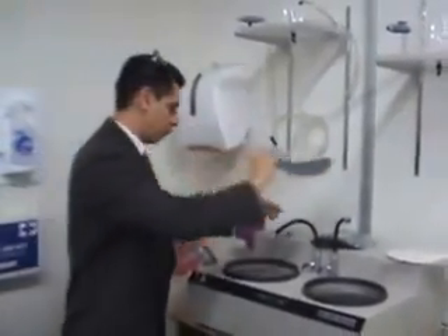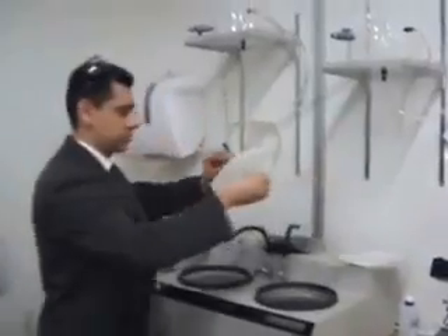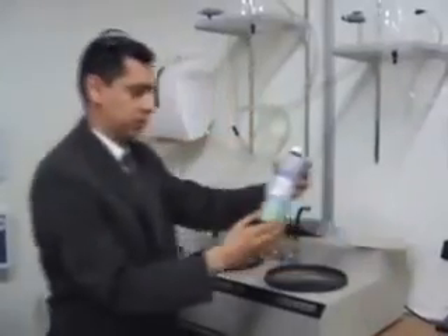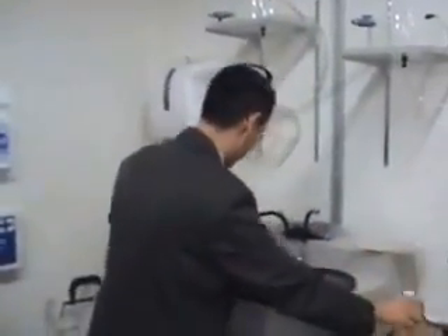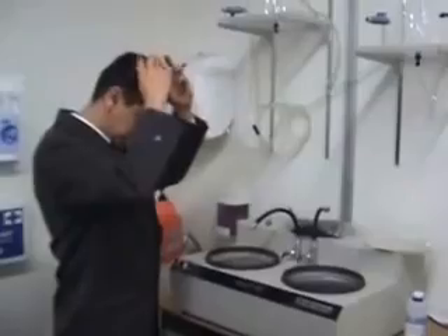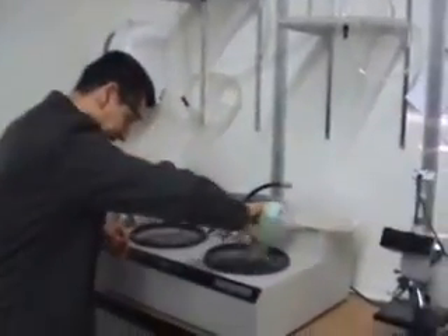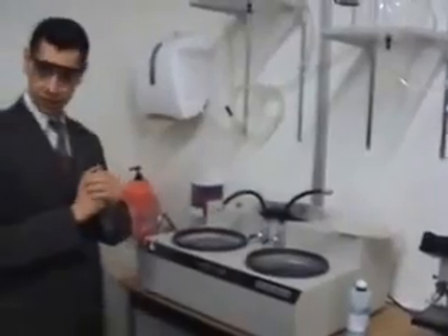After this, hopefully you have removed all the scratches. The next step will be polishing the surface. For that, you will be using this pad and then adding some of this liquid, which is diamond paste — could be 6 micron or could be 1 micron. Then the specimen will be polished. Make sure your hands are clean, because debris on your hands will affect the polishing disc.